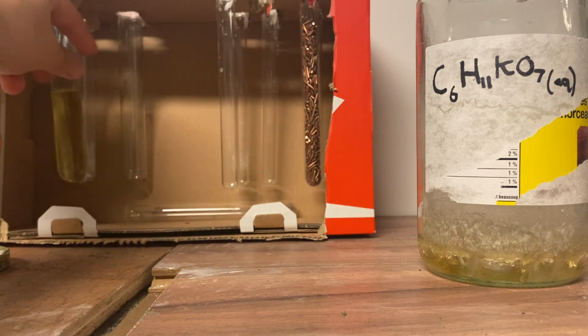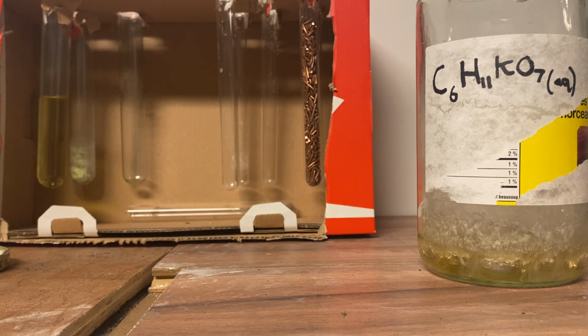I'm not sure how I'm going to separate it though. That's the hard part. So I'm going to do a bit more research about how to do that, because I know that potassium chloride is water soluble, but gluconic acid is kind of the same. Pretty sure it also is water soluble. So I'm not sure how I'm going to separate them. It's a very hard separation process, but it's pretty cool how I made those chemicals.